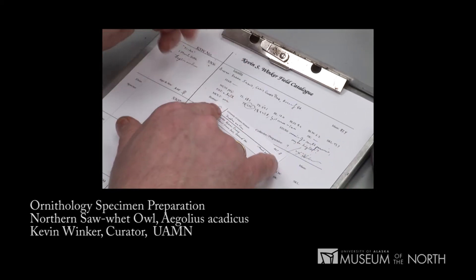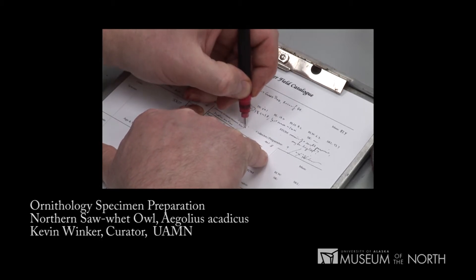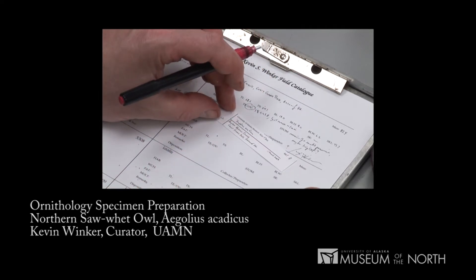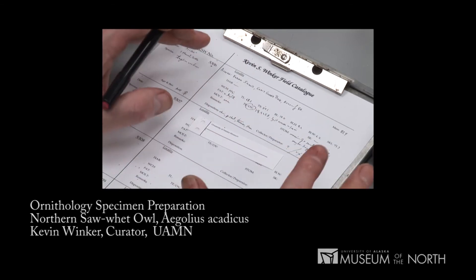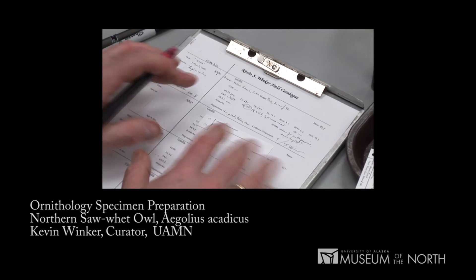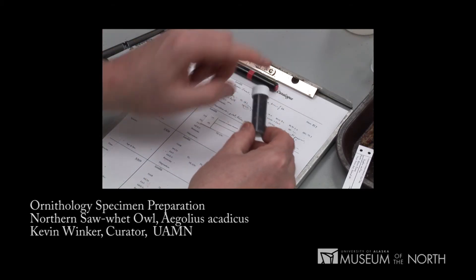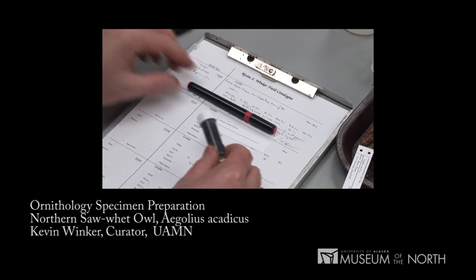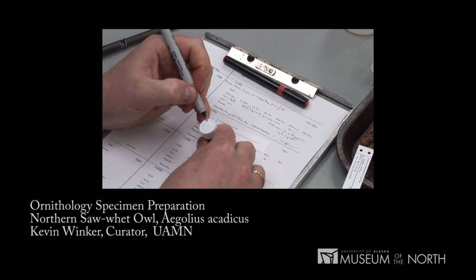Because that's an unlovely label, I'll write a much better one for the skin. I'll duplicate that number here, so that if the beetles should chew on the paper, they won't have gotten both of the numbers. That label then gets tied to the skeleton. I'll also put a small label inside the stomach vial in alcohol, using the same technical pen, and for ease of retrieval, I'll label the top of the stomach vial with my field number.